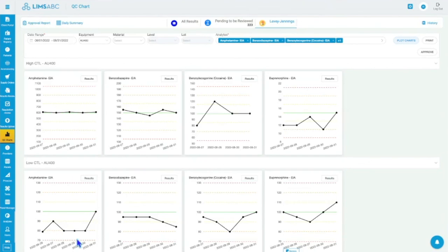So even though they're not a problem, your QC was below your 2 standard deviation, and now the next one is above 2 standard deviation. So that's still a possible thing to investigate. So we have all of those rules in place. Most labs don't turn them on, just the 1-2 standard deviation, which is plus minus 20% of your mean with a standard deviation of 10%.